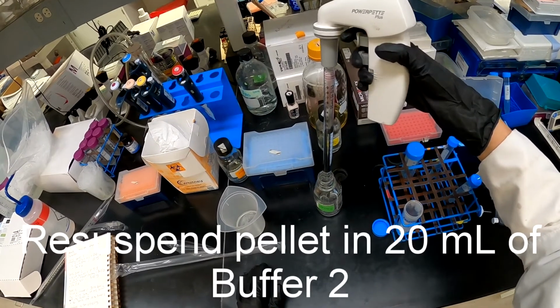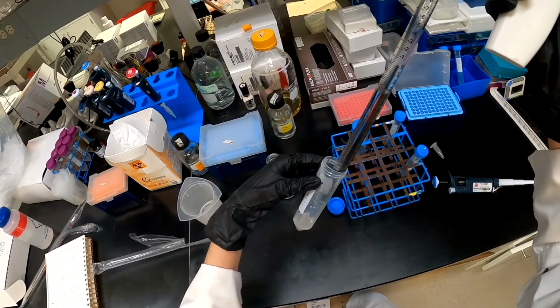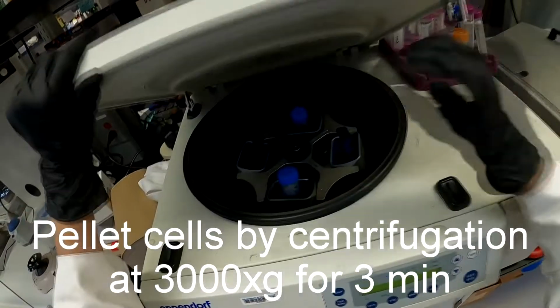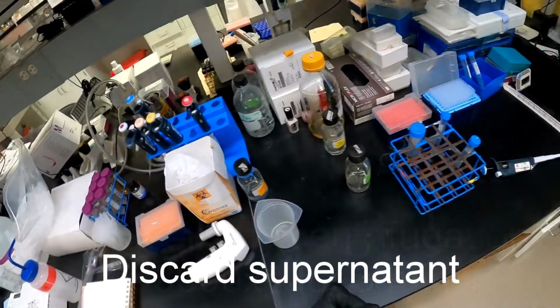Sorbitol acts as osmotic support. It raises the osmolarity of the solution. The cells were then pelleted by centrifugation at 3000 G for 3 minutes at room temperature. The supernatant was then discarded.